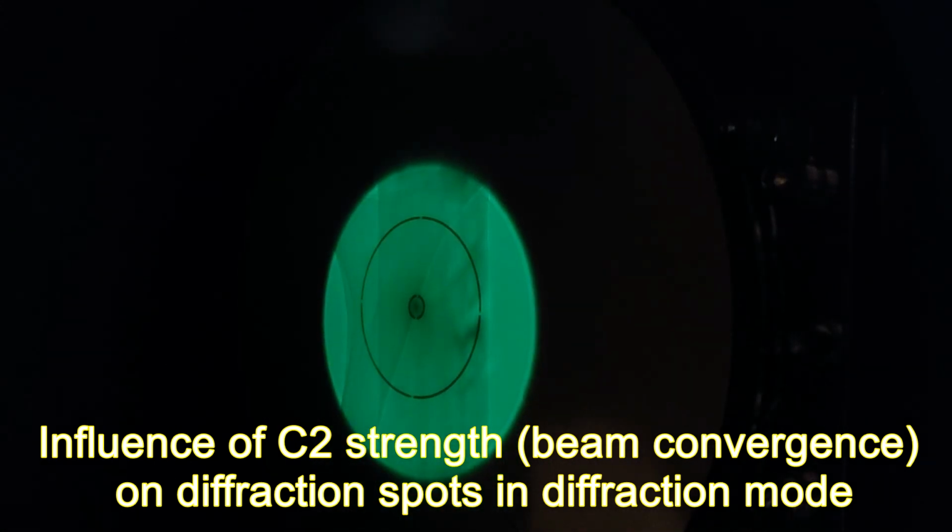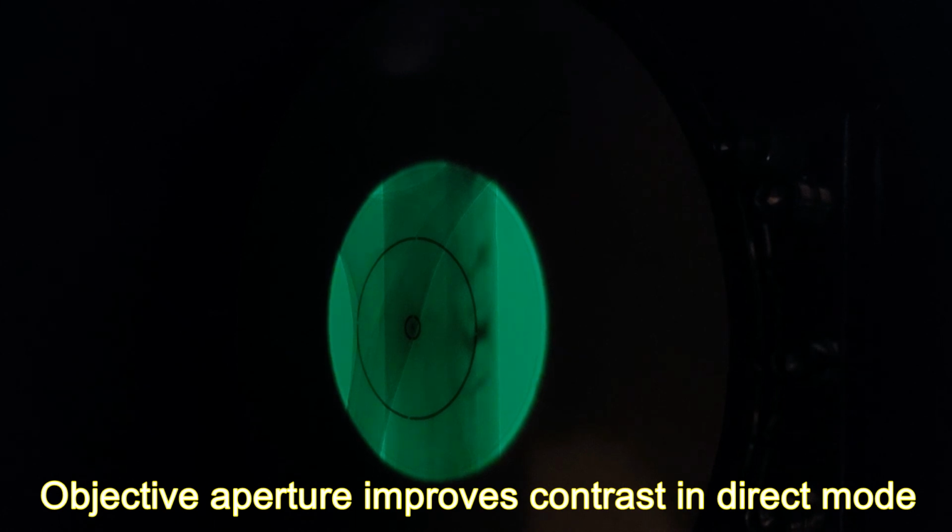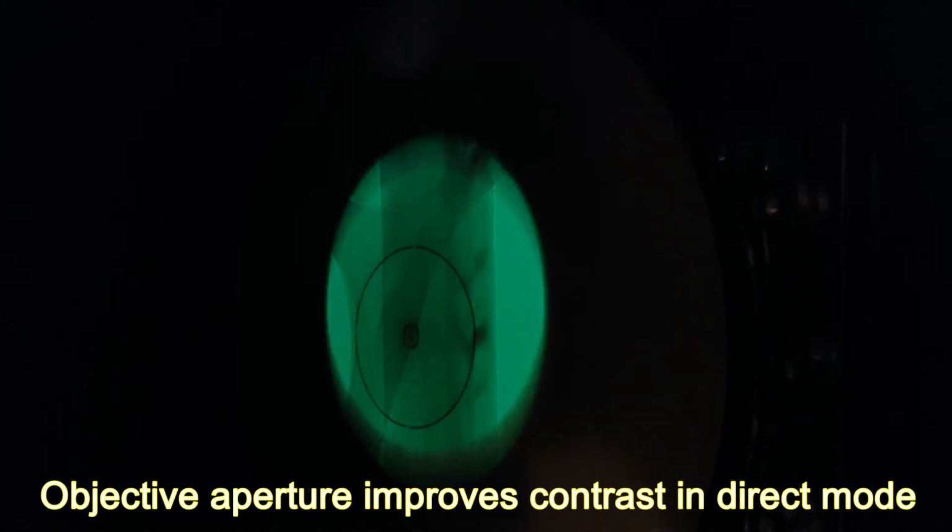In focus, I'm back to parallel. I can put an objective aperture in. That enhances the contrast in real space. See, the contrast is now sharper, and these diffracting fringes are sharper. And if I look at the diffraction pattern, you see what's happened: we've cut out most of the diffraction. Can put it back in. So whatever power diffracted into these spots is now missing from the image formation.